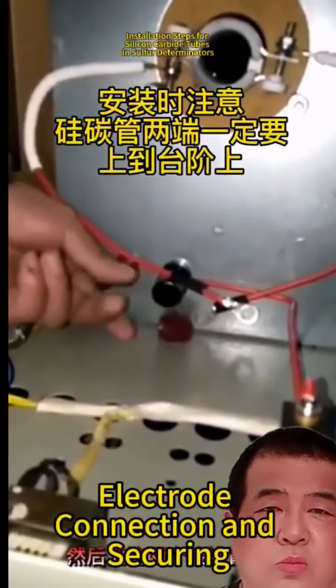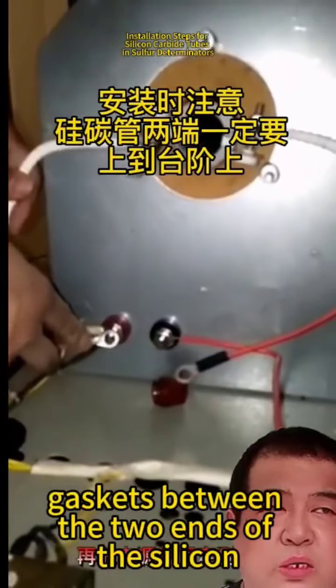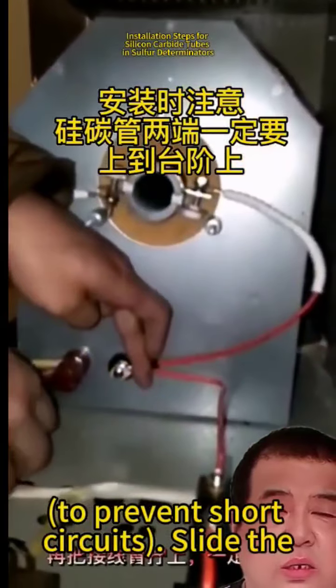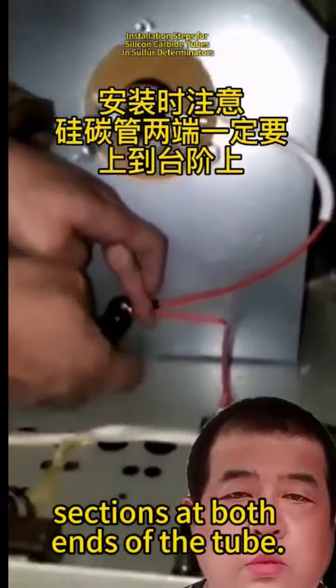Electrode connection and securing. Place high temperature resistant insulating gaskets between the two ends of the silicon carbide tube and the electrode contacts to prevent short circuits. Slide the electrodes over the conductive sections at both ends of the tube.